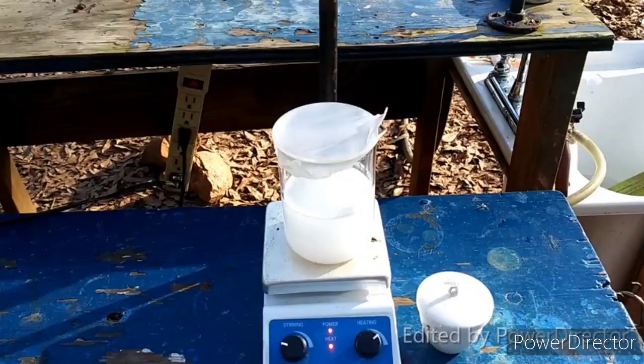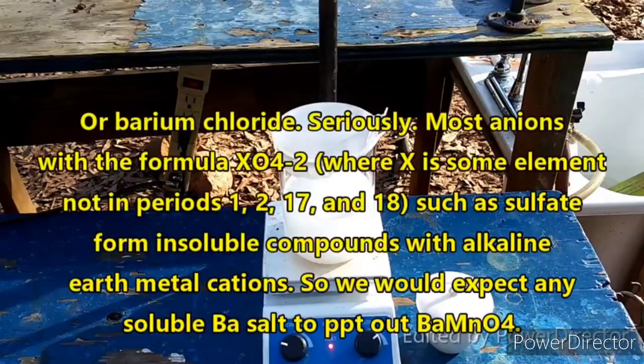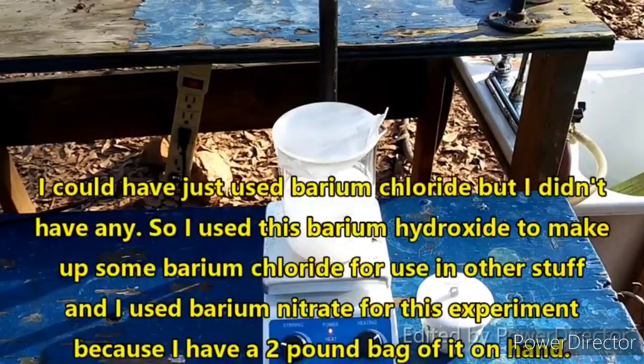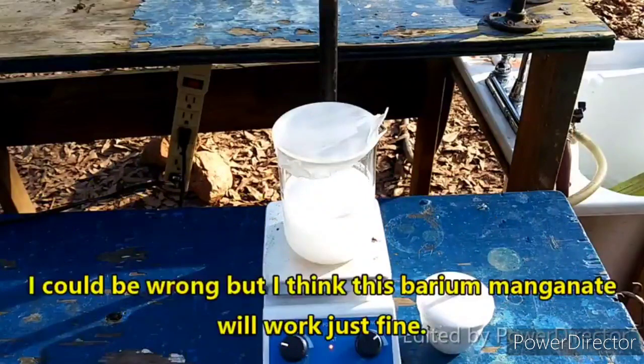All the barium carbonate should dissolve at pH 7. Why you can't just use a solution of barium nitrate is beyond me — I honestly cannot understand why it has to be pH-adjusted barium hydroxide. But the paper says that barium manganate produced by this method gave very reproducible results when used in organic chemistry, so we're going to give it a try and see what we get.